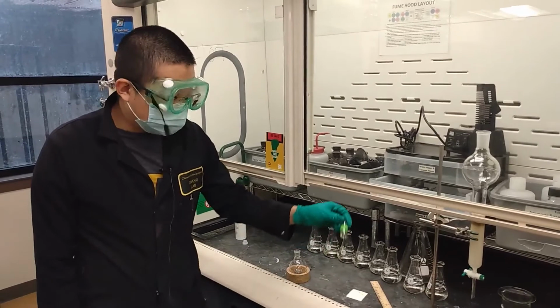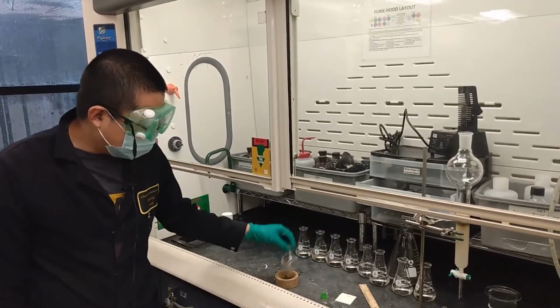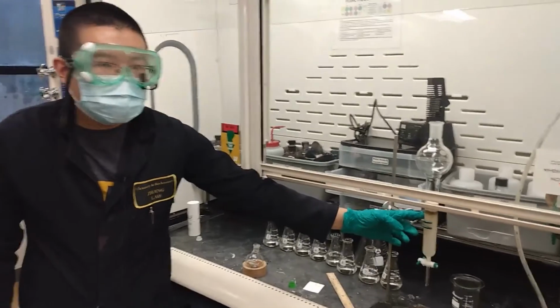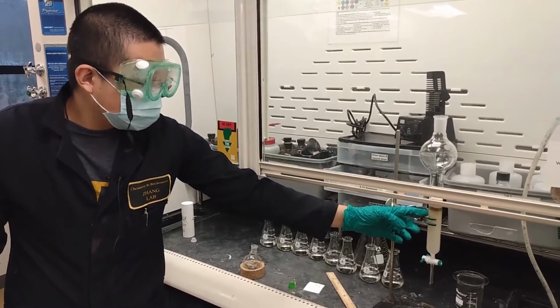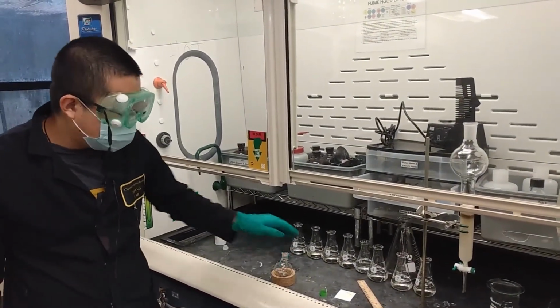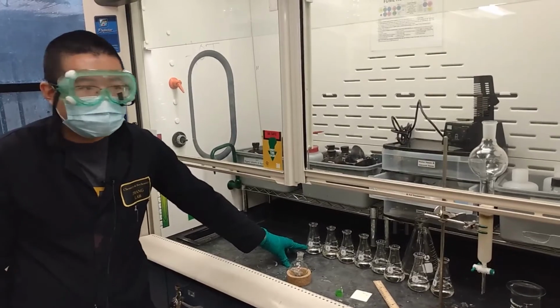Okay, so after stirring the reaction for more than 24 hours, we transfer all the stuff in the vial to a round bottom flask, and then we load all the contents with silica, and then we run a big column to purify the product. In general, we use a solvent mixture to purify the product, the mixture of petroleum ether and MTBE, from the lowest polarity to the highest polarity, and we collected 8 fractions. Each fraction contains approximately 75 milliliters of solvent.